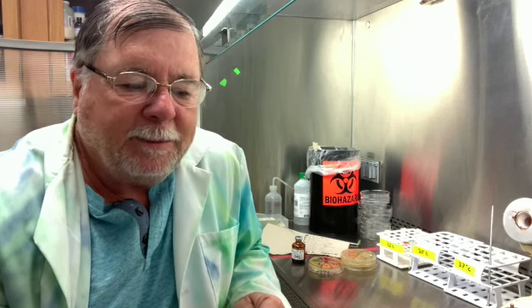But keep in mind, you want to get this right, because if this were in real life, the physician or healthcare provider of a patient is relying on the identification of the bacteria in many cases to be able to treat it properly. And so this is just an introduction to unknown identification, and the people in the lab tech programs, lab techs, they do this day in and day out.